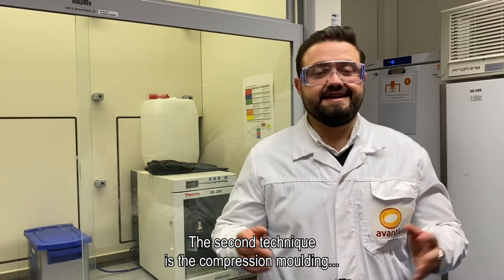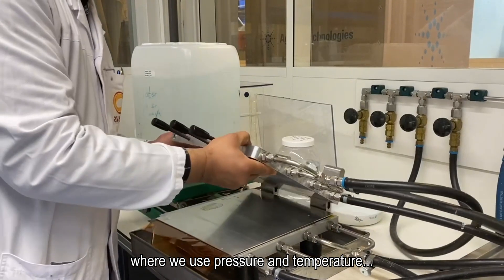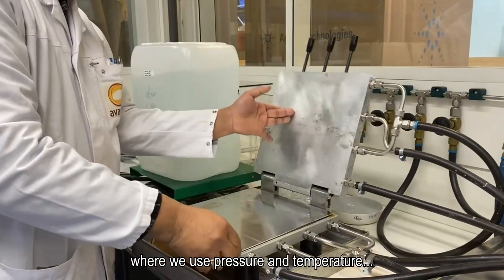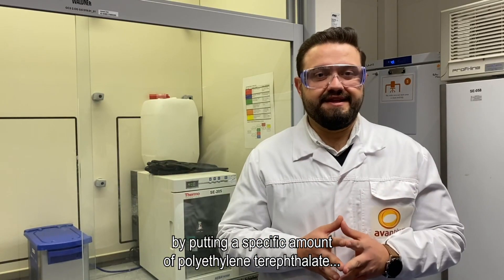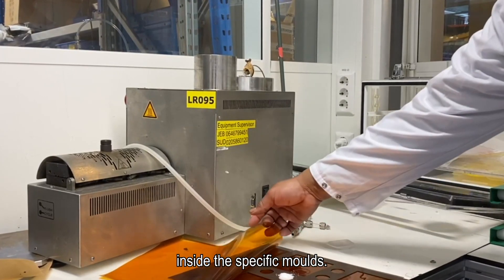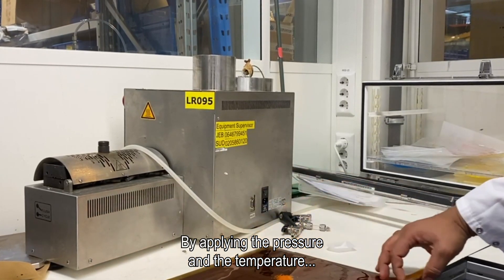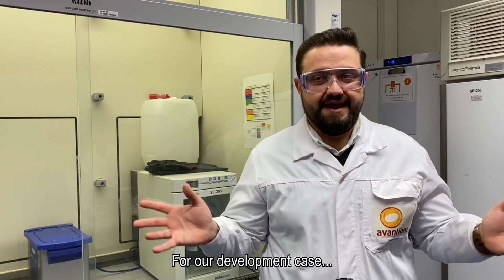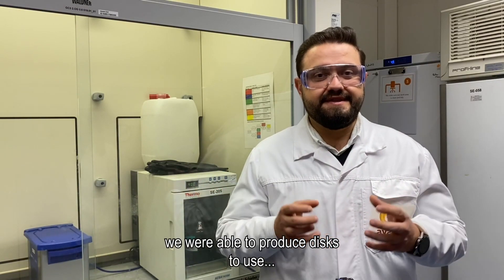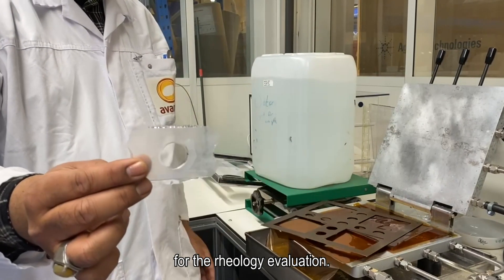The second technique is compression molding, where we use pressure and temperature by putting a specific amount of polyethylene terephthalate inside specific molds. By applying the pressure and the temperature, we are able to get different objects, and for our development case we were able to produce discs for rheology evaluation.